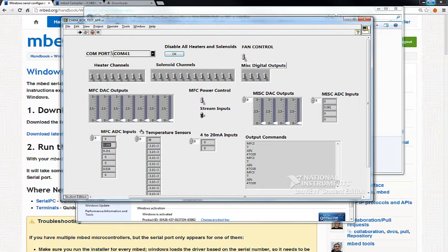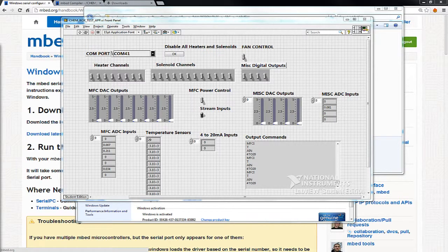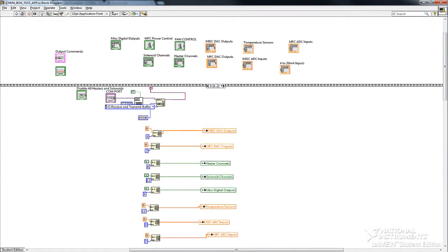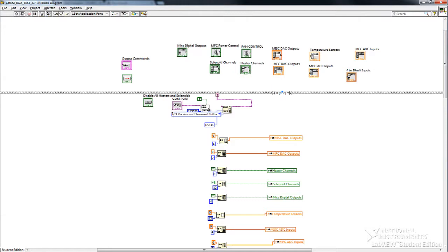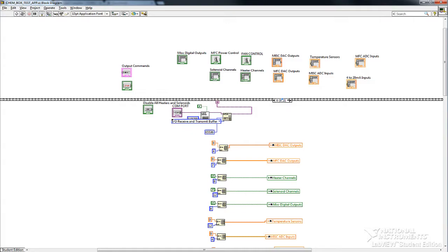It's just a LabVIEW program. And I'll just show you real quick how it's structured. I hit stop. And I'll go Window, Show Block Diagram. Now, all LabVIEW programs can be somewhat complex. But the way this program is structured is that I have a huge sequence structure that wraps around the whole program. So in the sequence structure, the first thing I do is that I initialize the COM port, and I set up some buffers, and then I just initialize all those controls on the front panel with these local variables.